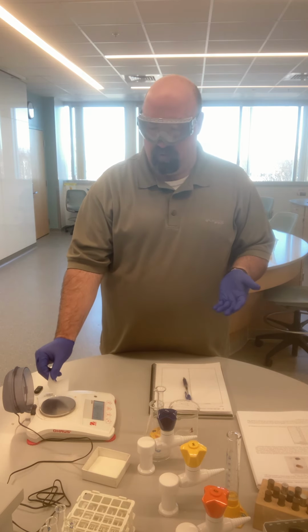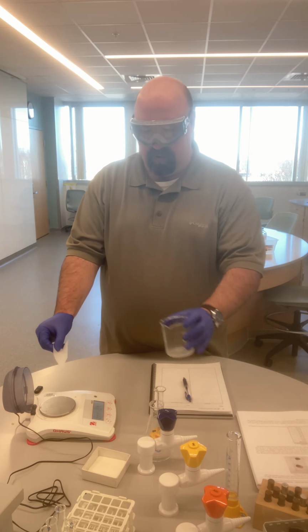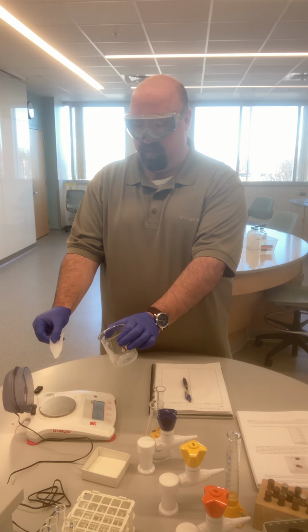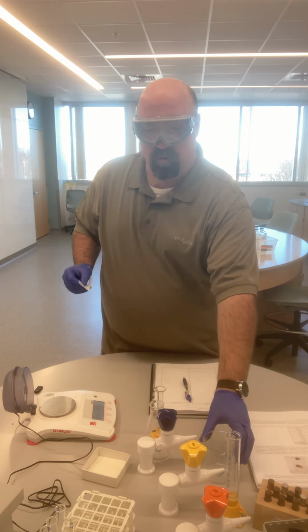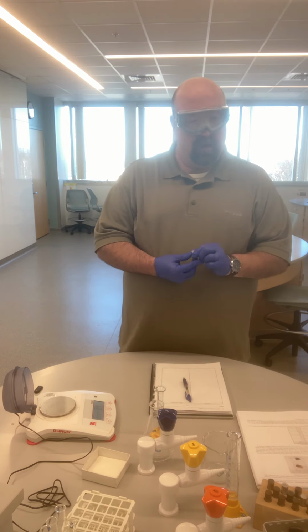If this were real, I'd be doing this very carefully so I don't spill any. But then I would pick it up, I would have whatever I'm going to run my reaction in, maybe a beaker right next to me, and then you just dump it right in. And so that's how we would use a balance like this in order to find the mass of some solids.